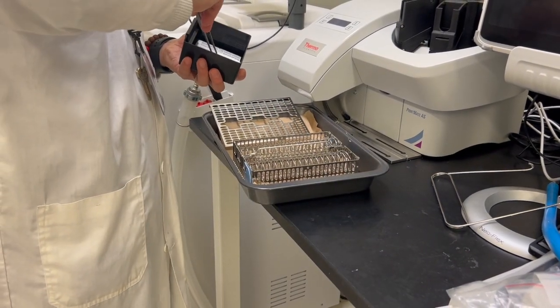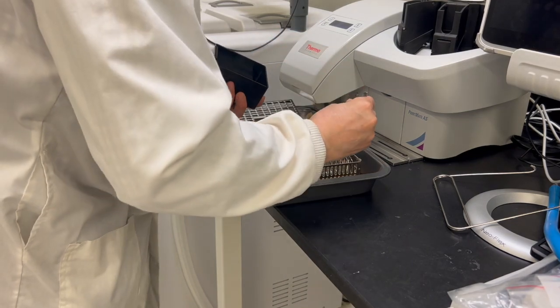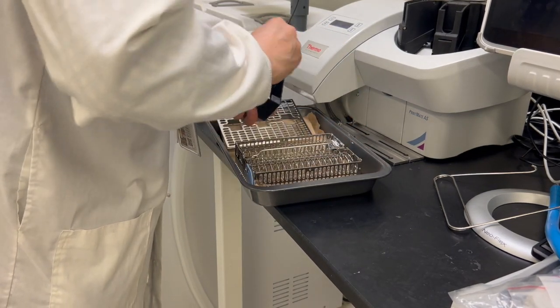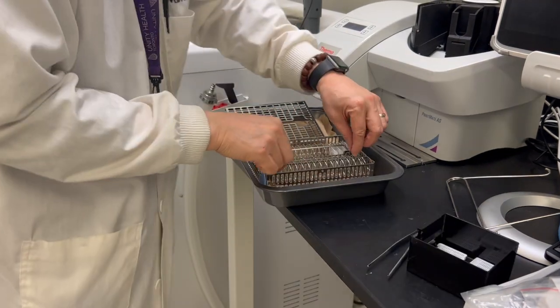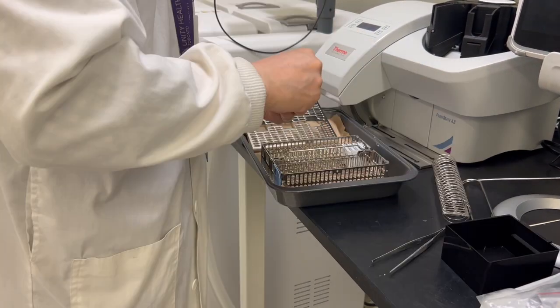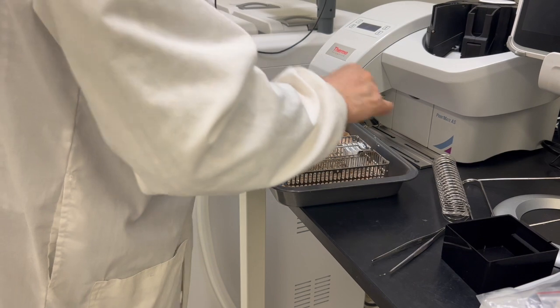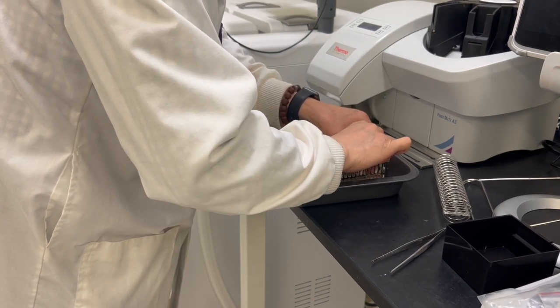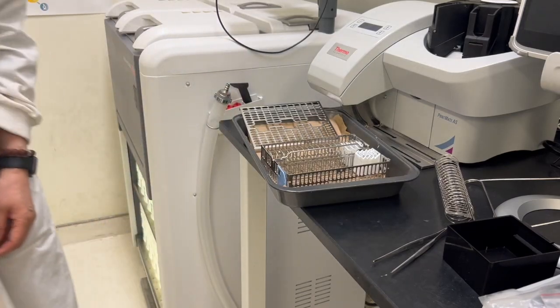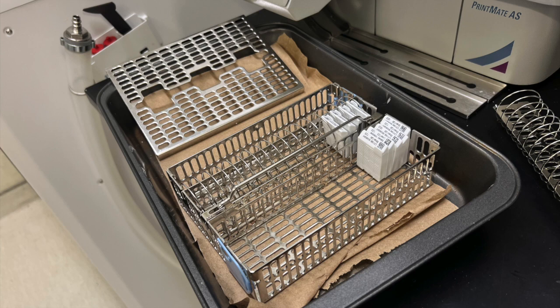With the spring and division board, the basket can be filled with up to 72 cassettes. Without a spring and division board, the cassettes can be packed in more tightly, so that a maximum of 100 cassettes can fit into one basket. One retort can hold two baskets, so a maximum of 200 cassettes can be processed in one retort. The basket with a spring and basket division ensures optimum reagent flow with minimal carryover. So, if you don't need to process the maximum number of cassettes, please always use the spring and the basket division.